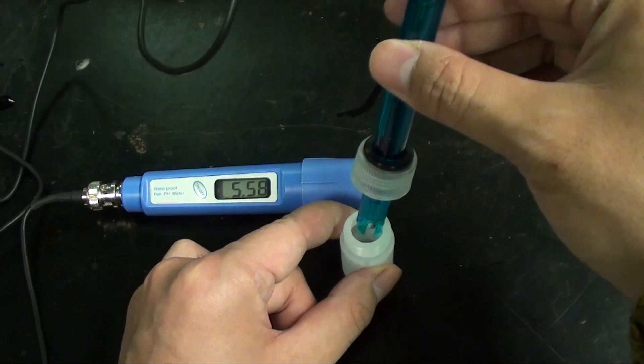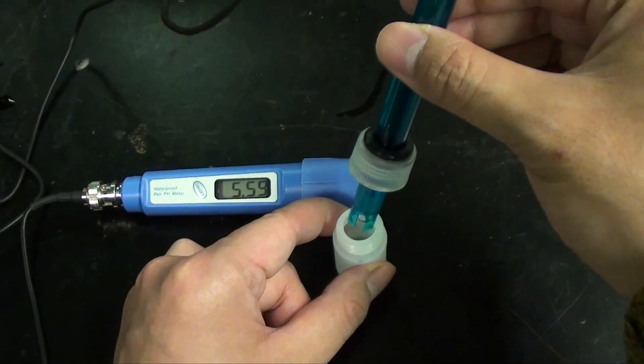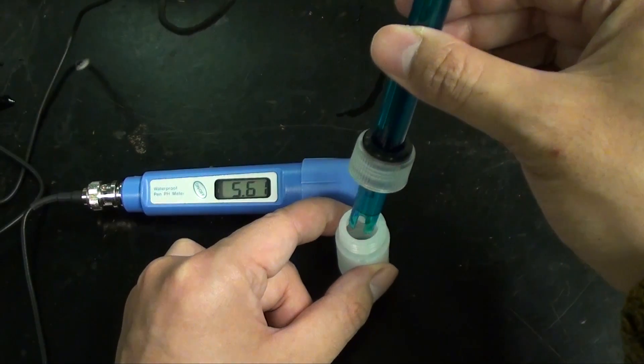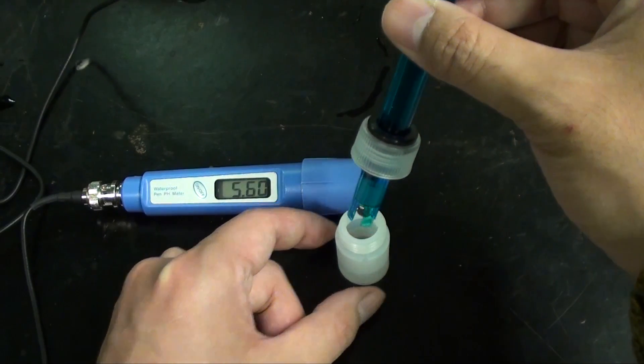Do not let them dry out. And do not store them in distilled water, as this leaches out the ions in the glass that make it work. Now let me show you the actual glass electrode.